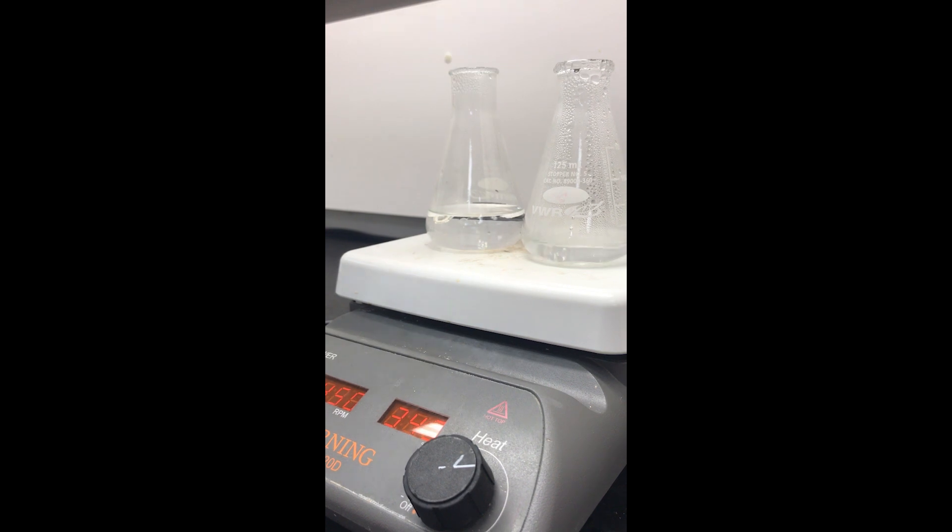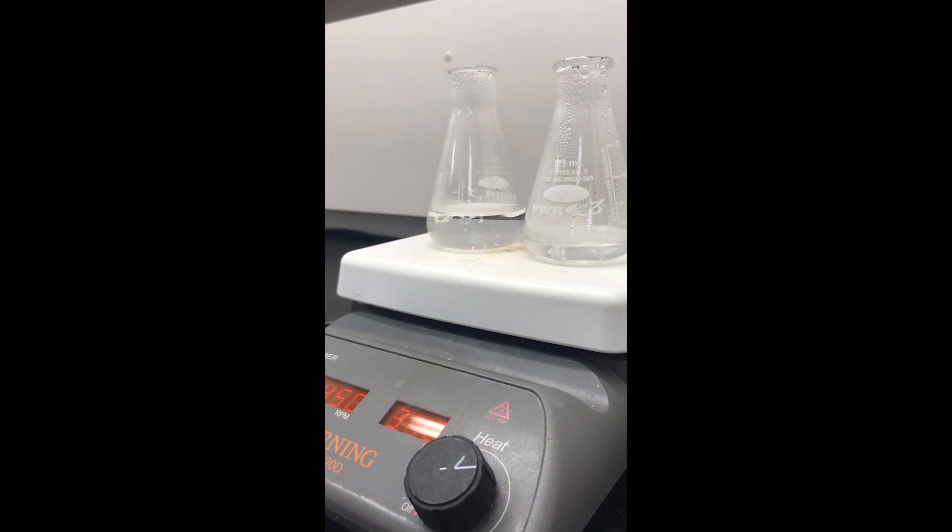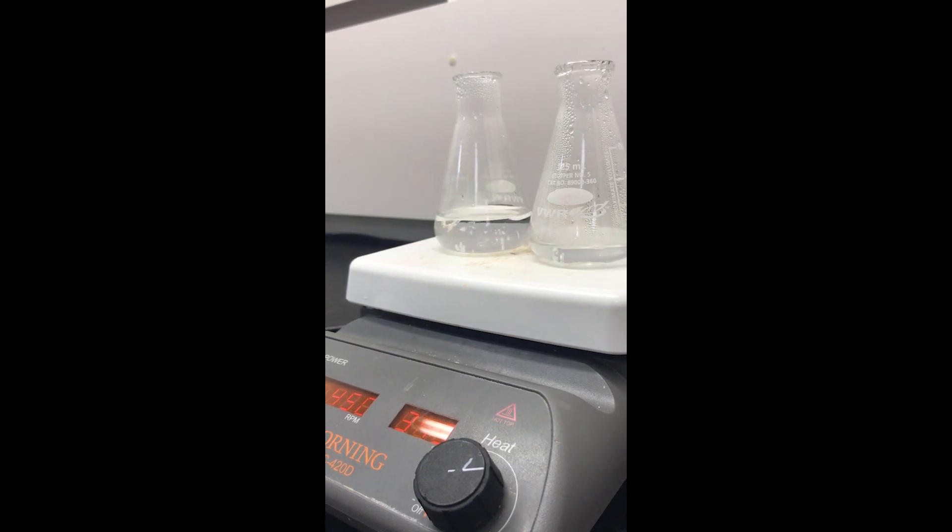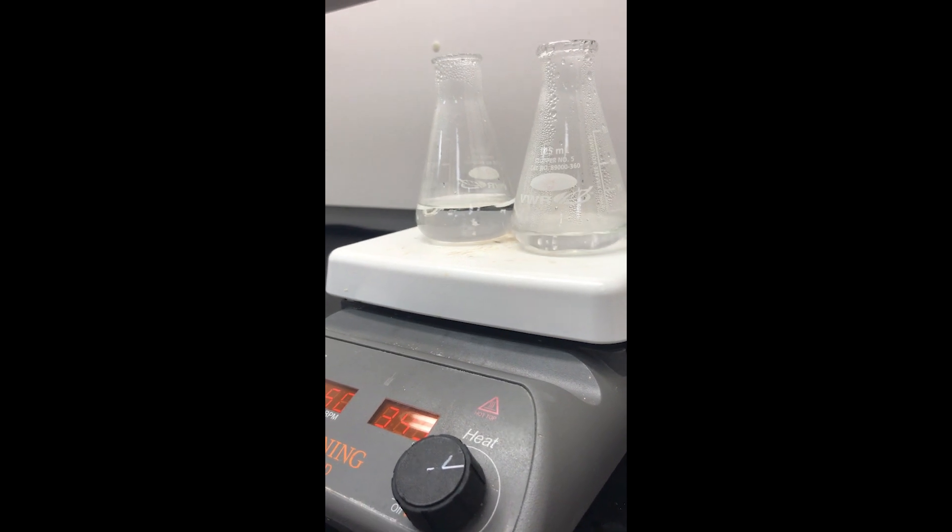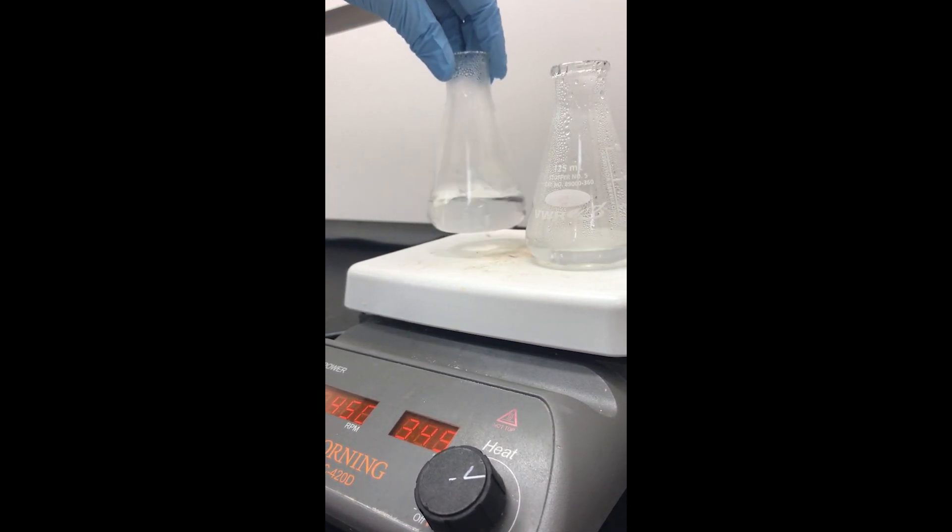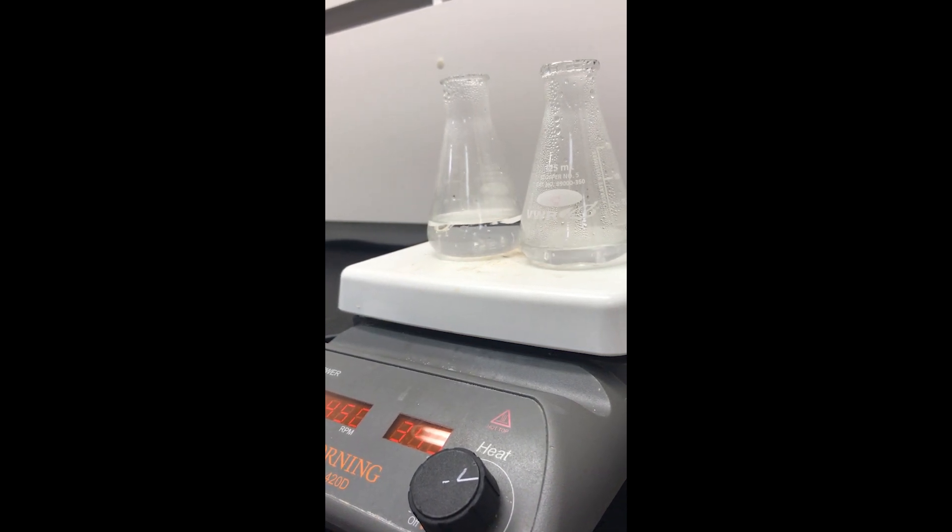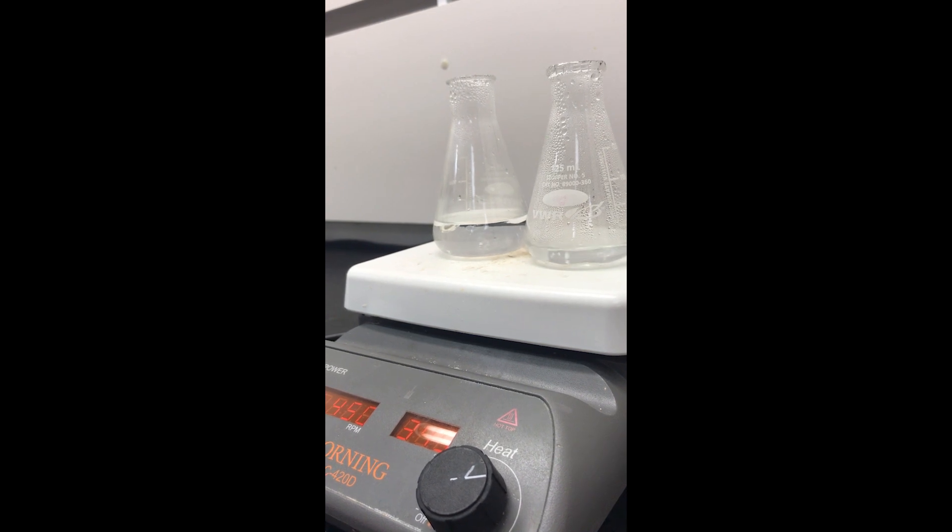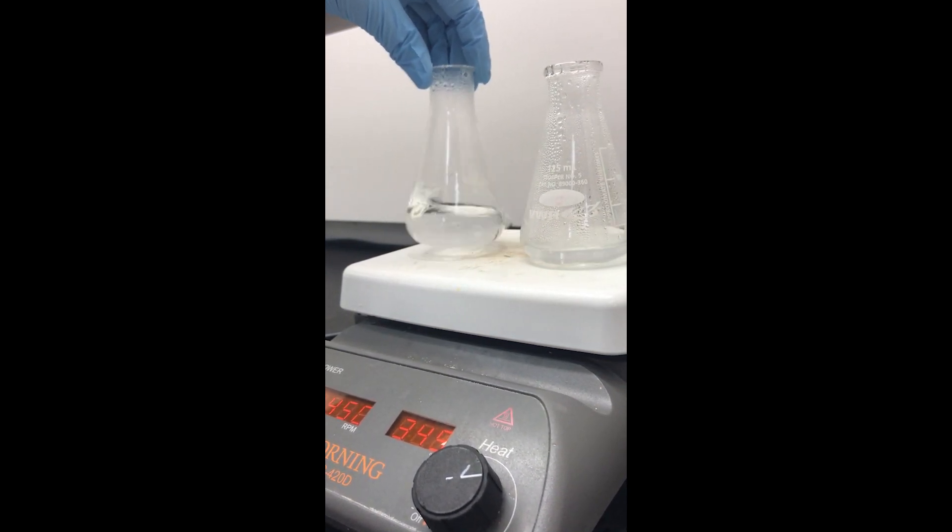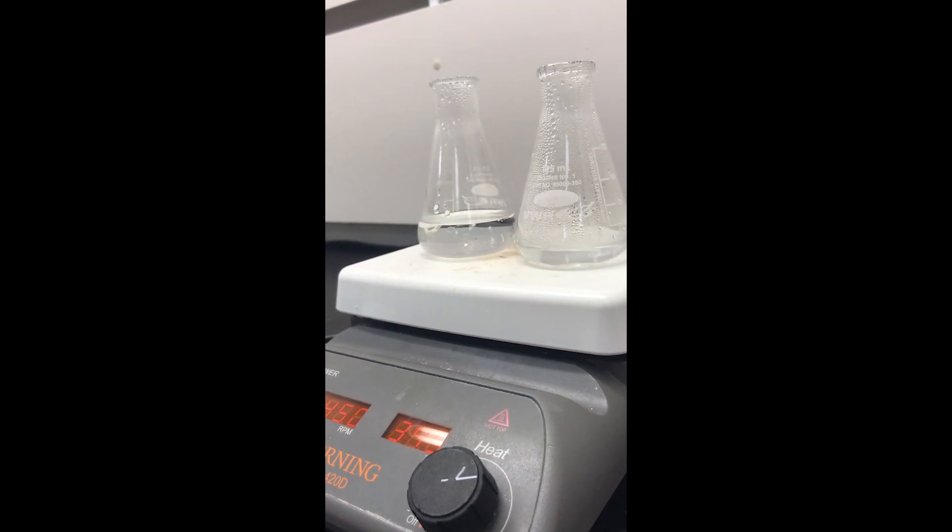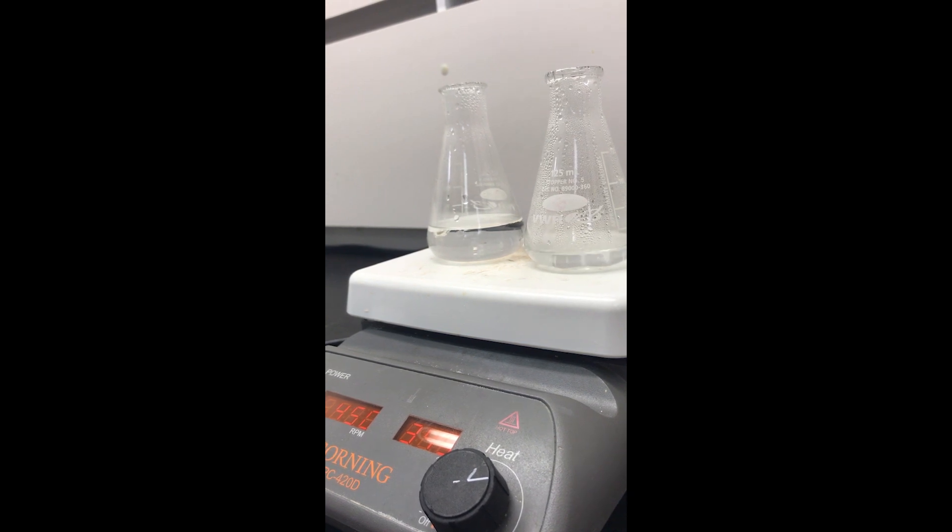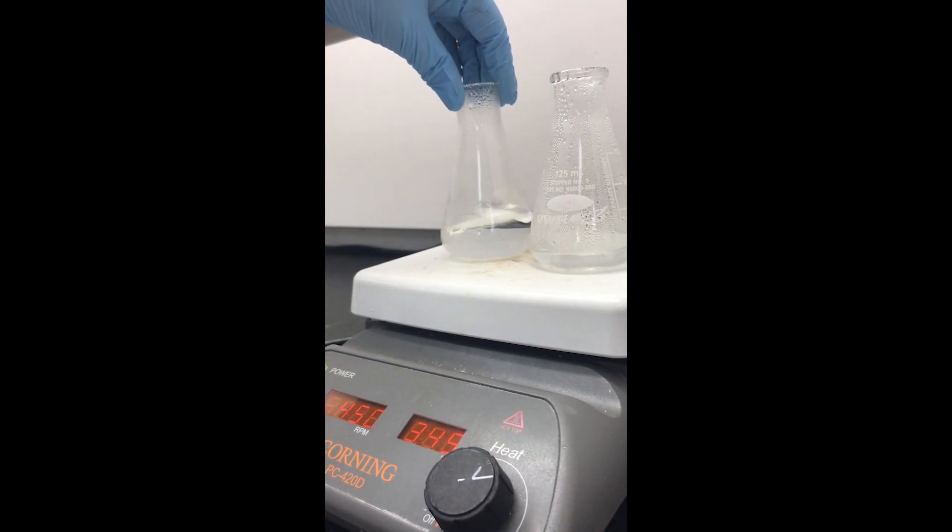I'm just going to be patient with it for a minute, see if letting the water heat up a little bit more will dissolve it, and if not, I'll just add a little more water. Sometimes it seems like it takes forever just to get those last little bits of solid to dissolve, and that's just because typically you're being a little more careful at this point, not just pouring a bunch of water in.